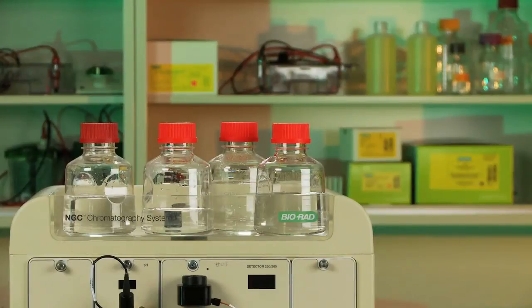Prime the system pumps with buffer or HPLC grade or other high-quality water.